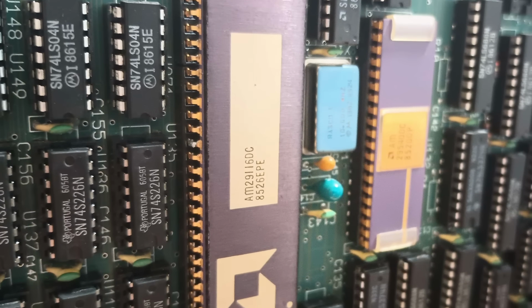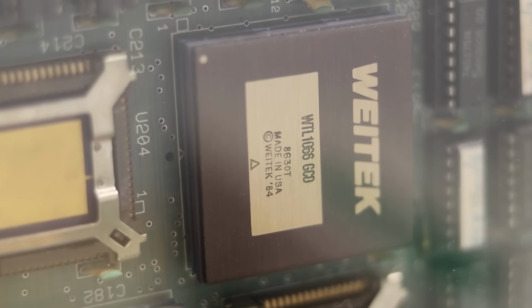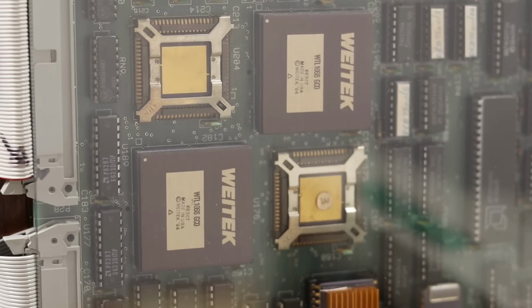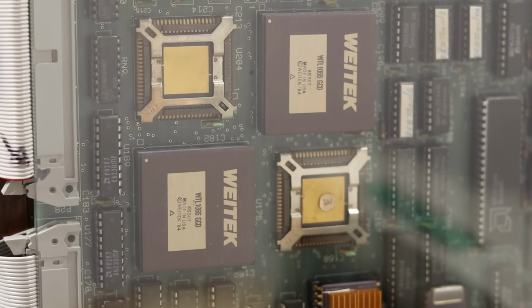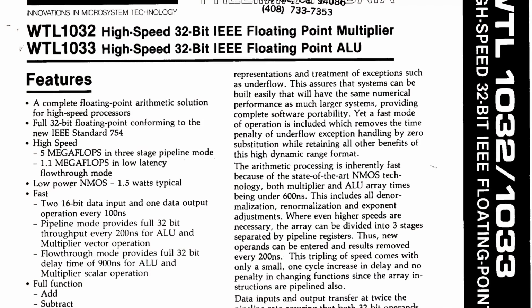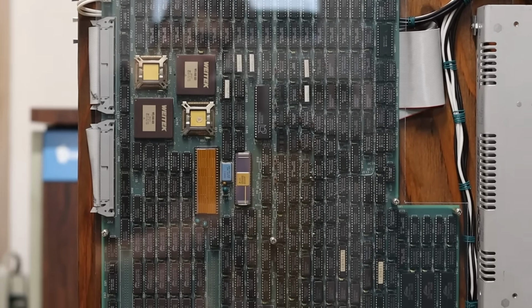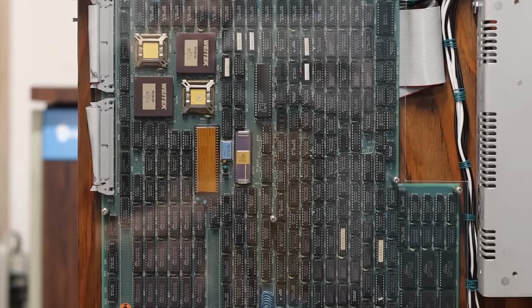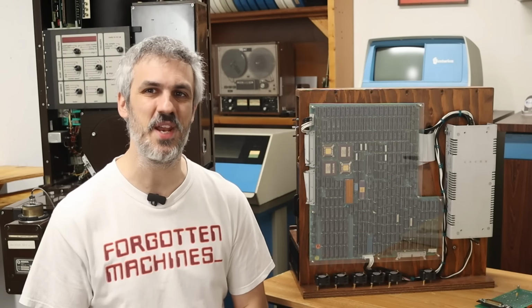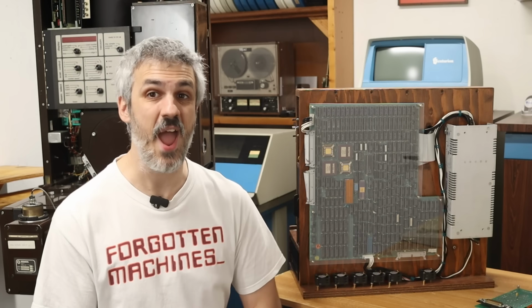It has an AM29116 16-bit bit slice processor in it, 2 massive Weitek register files, and these 2 little chips right here, even though they're not marked, I'm pretty sure are WTL 1032 and 1033s. It's going to be a hardware multiplier and a hardware adder. And there's a boatload of high-speed static RAM in this thing that the microcode is loaded into to do its multiple instruction, multiple data, vector math, and knock out fast Fourier transforms in under half a second.